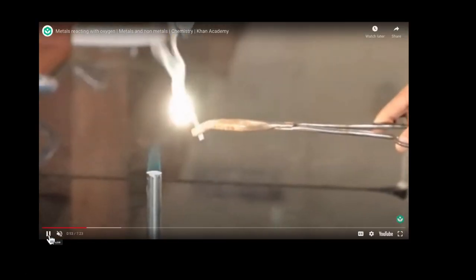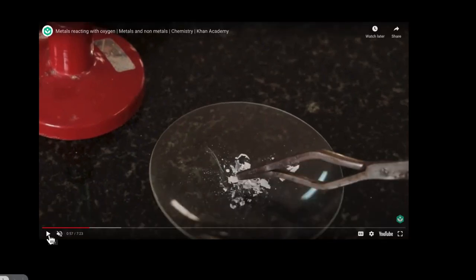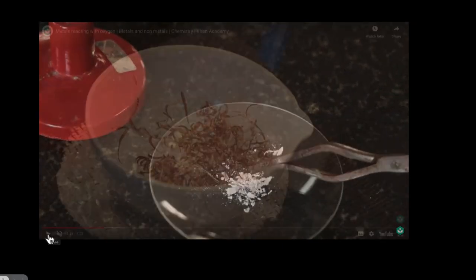Oh, it burns very nicely and we get this white powder. So what's going on?